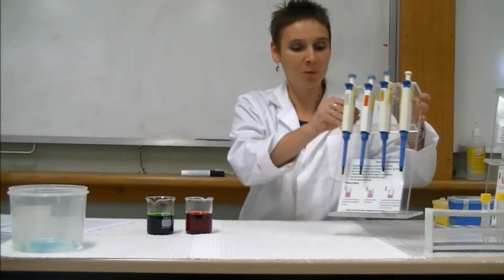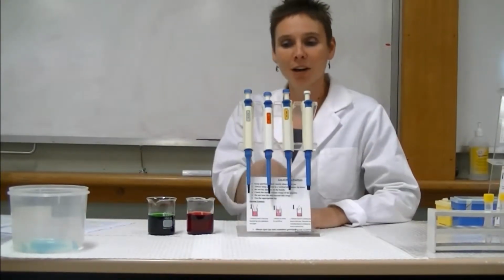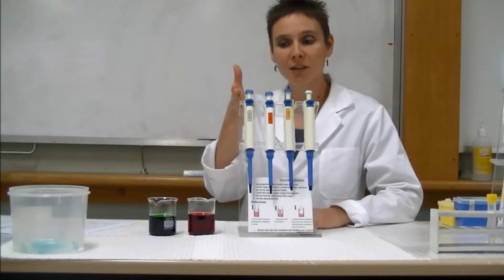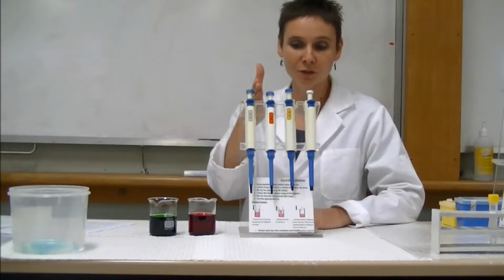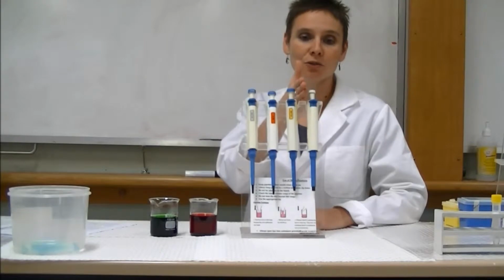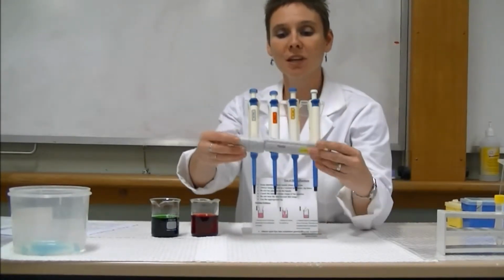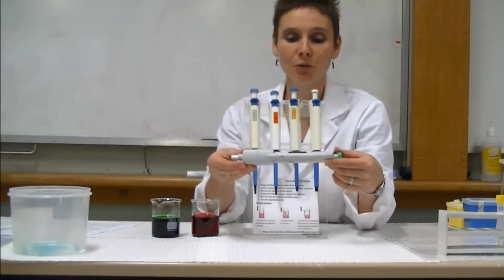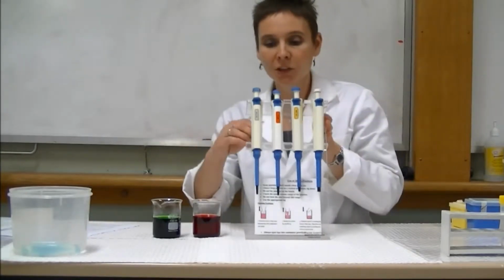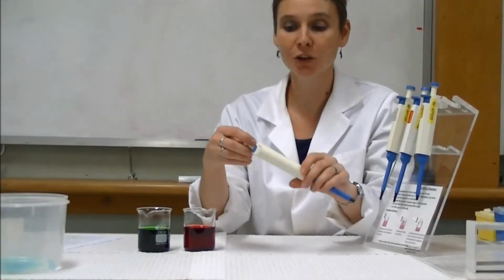So let's have a look at the pipettes that you will see in the classes here. You can see they come in a range of volumes, from the smallest, which is 0.5 to 10 microlitres, 5 to 50 microlitres, 50 to 200 microlitres, and 200 to 1000 microlitres. You will also come across the 1 ml to 5 ml pipette also, but probably not use this one quite so much. So let's go through the parts of the pipette that you need to know.